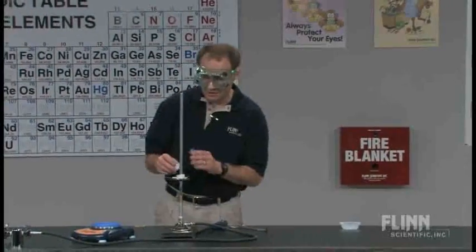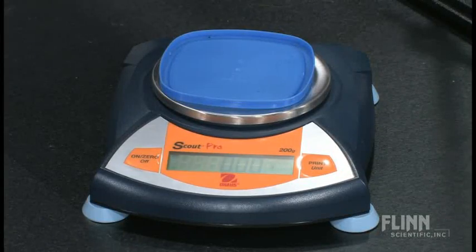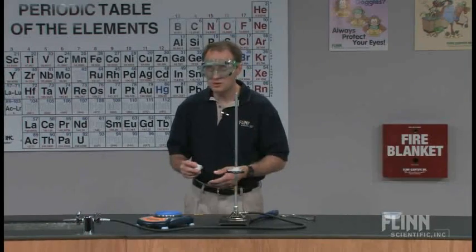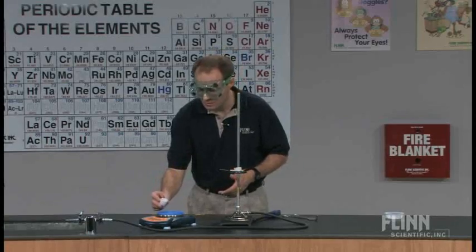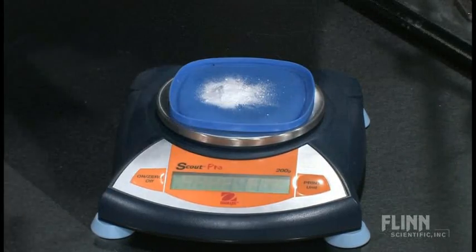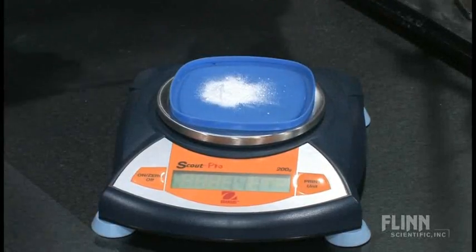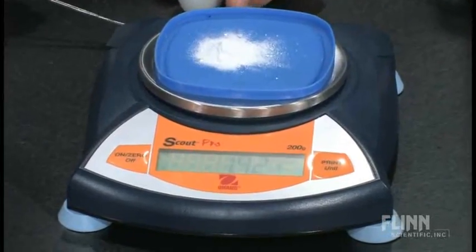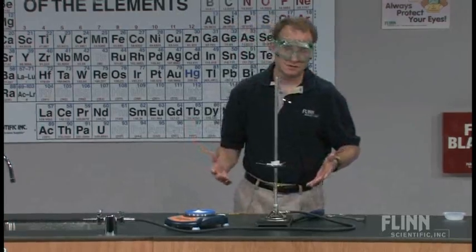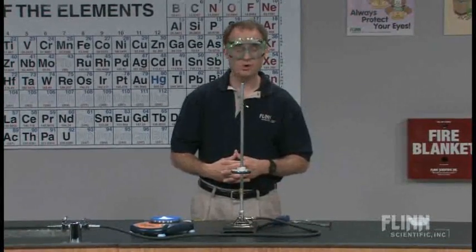So I've got my balance zeroed. I would say to the students, what was your target mass? And they would say, our group was assigned 2.00. And let's see how close we were. 1.92 grams of solid sodium carbonate — certainly very close to the 2.00 grams that we were assigned. And then you can grade your students based upon their percent yield. A quick percent yield calculation: well above 90%.